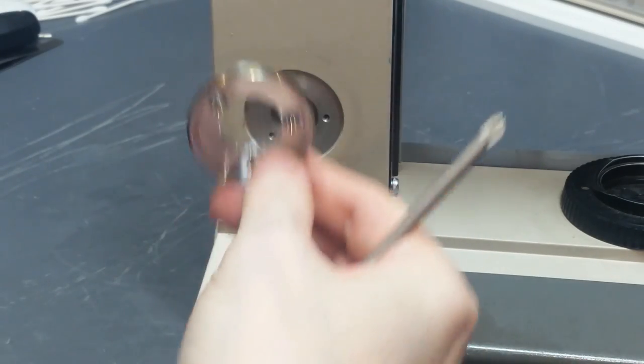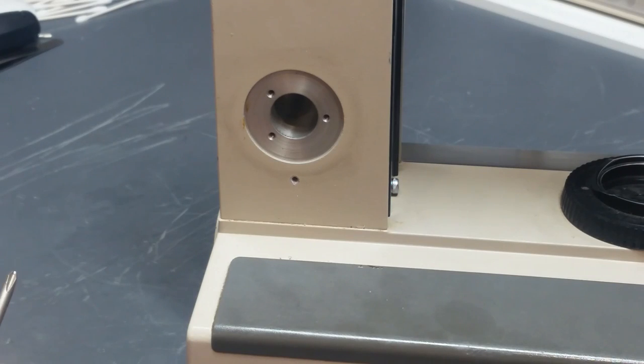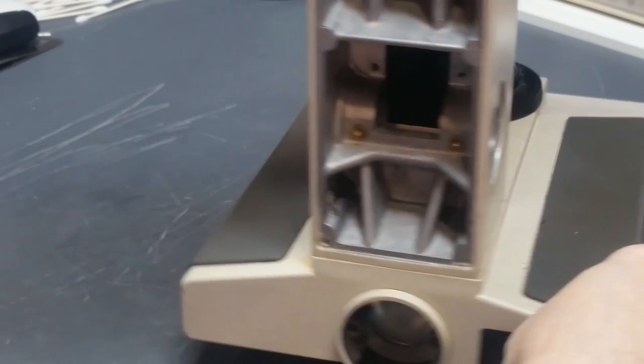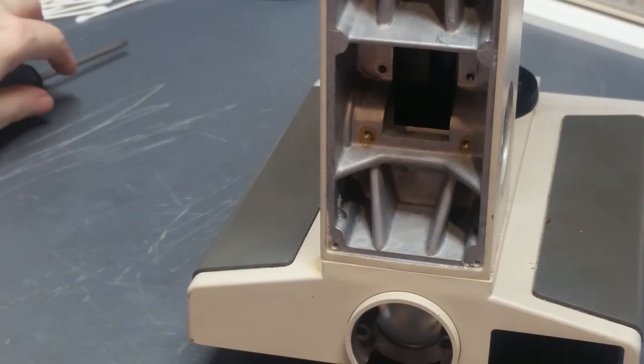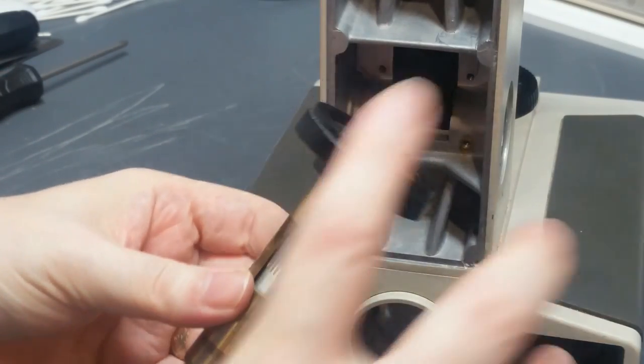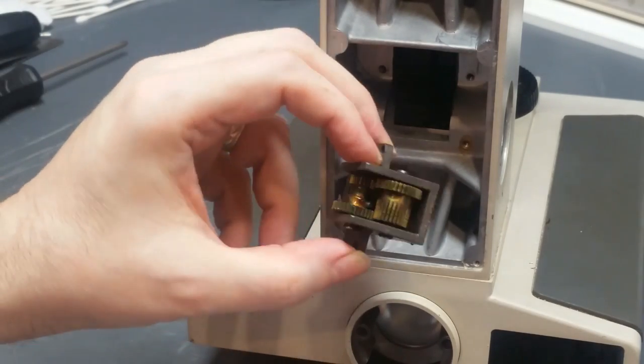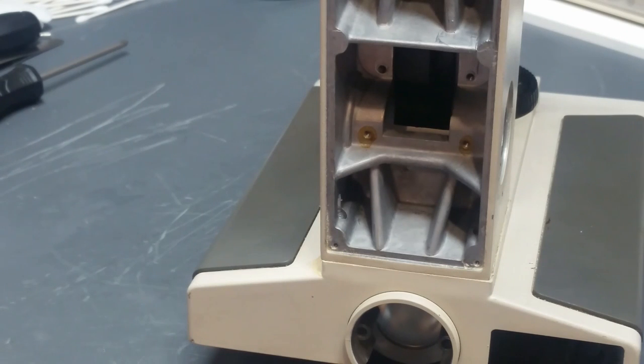So now that can be cleaned, and all that grunge around there can be thoroughly cleaned, and that's a good thing. Okay, I think that's it for the fundamental disassembly of the scope stand. We'll still have to disassemble this and clean it. There's a lot of work involved in just this piece right here. We still have the gearbox to clean before we can put it all back together, and all those individual pieces I took out, I'll clean most of those just off camera, and then we'll start putting her together.